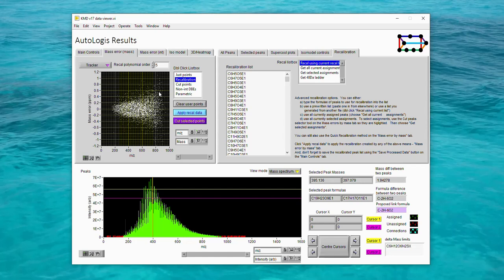You would know if you had the sorts of issues that this walking calibration can correct for, if when you zoom into your data you can see that there are short range mass error trends across multiple 1 or 2 Dalton ranges in your results, so that the mass error plot looks like a saw blade when you look at the detail. Commonly these might be resulting from some issue with the way the instrument has been set up, but this walking recalibration will allow those issues to be partially corrected for. However, on normal data such as we have here, this Walker mode would be overfitting the data and so would not normally be used. However, as we have this file open, we'll use it for demonstrating how to set Walker mode up.